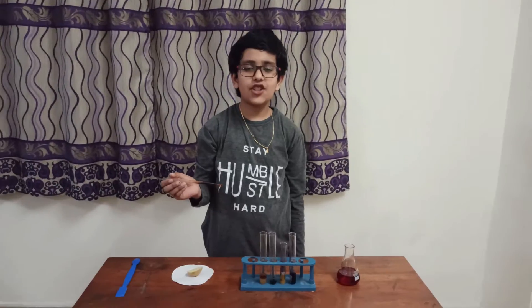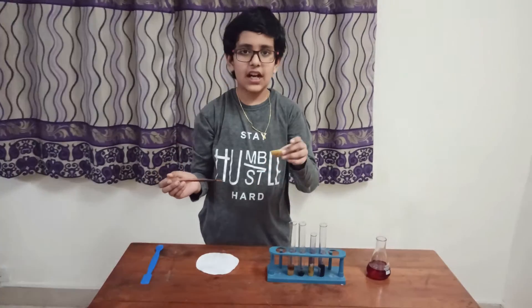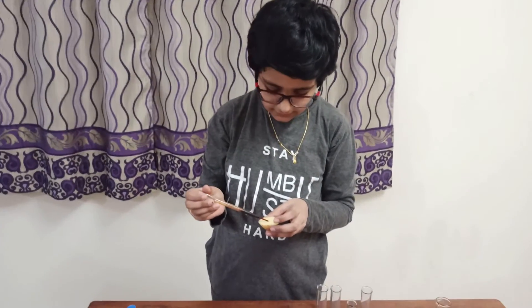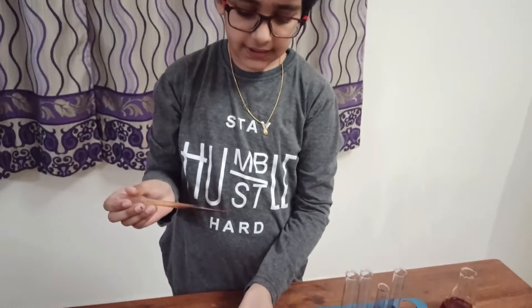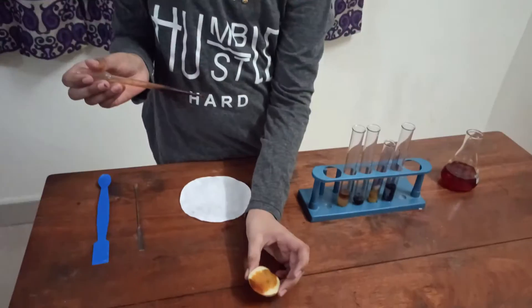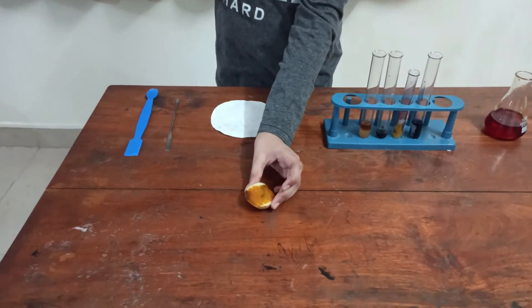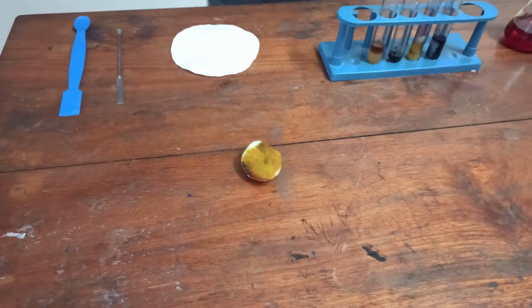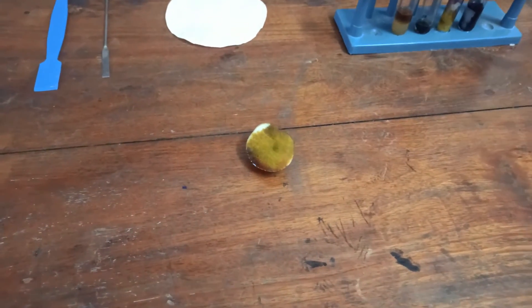Next, we are going to determine the presence of starch on this potato. When we add some iodine solution on the piece of potato, it turns a purple-black color. If we leave it for longer, it turns more black.